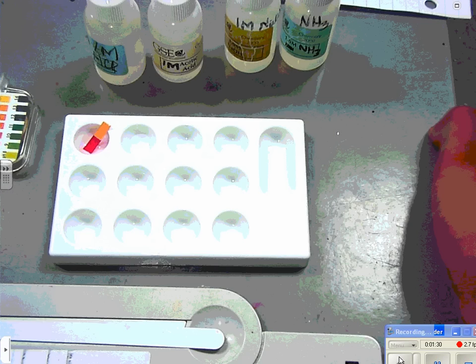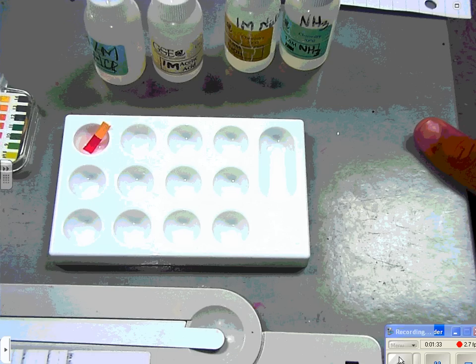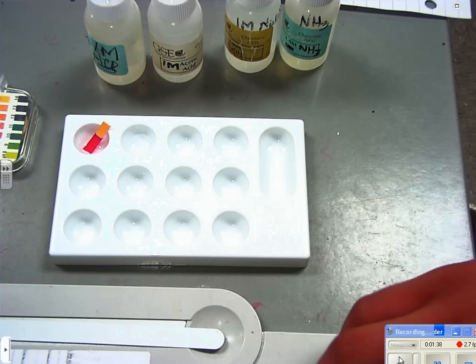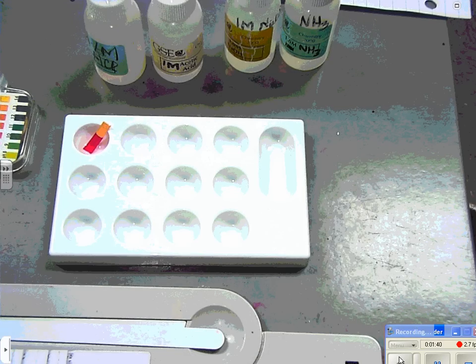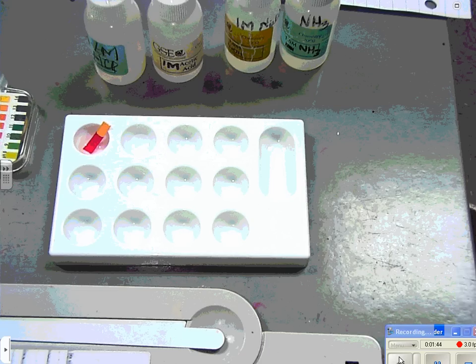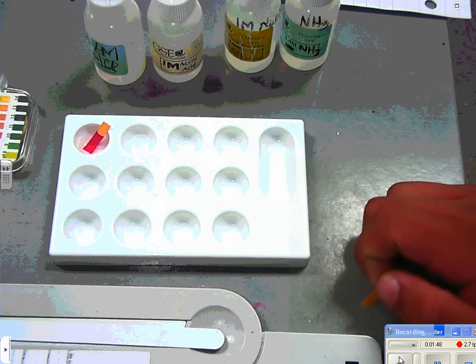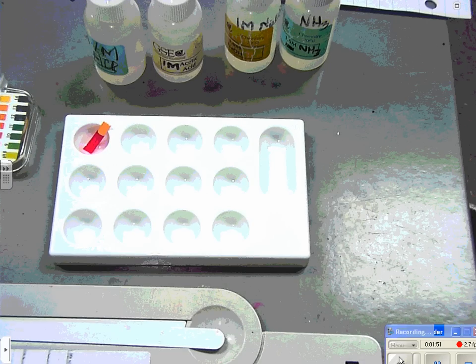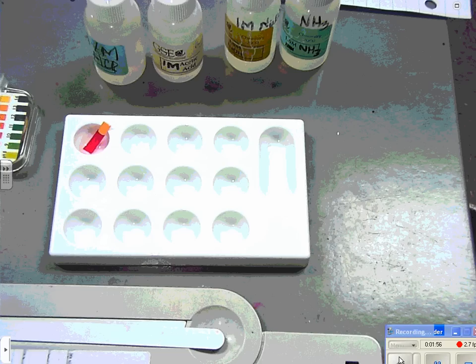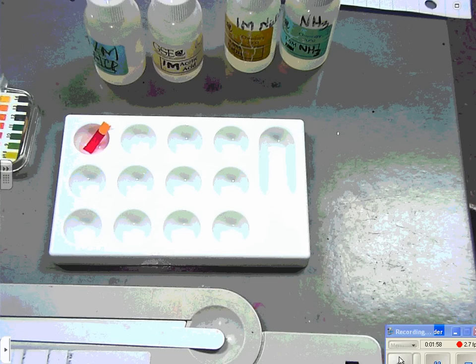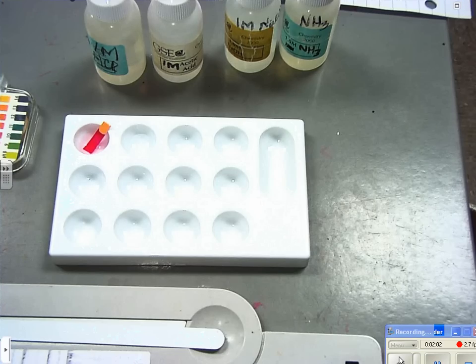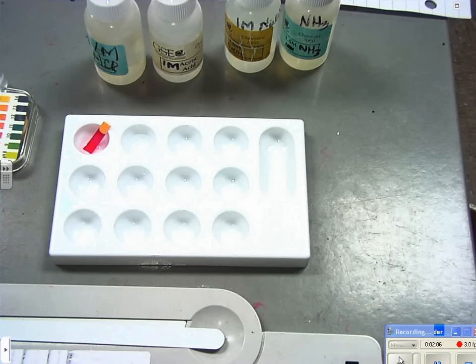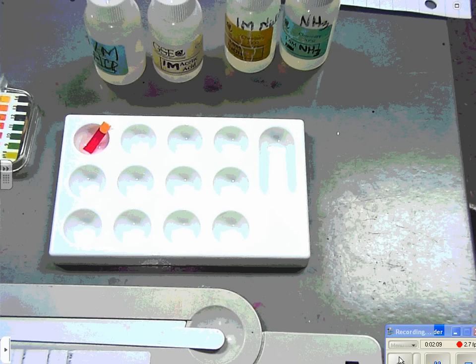Now we're gonna leave that in there and you're going to see by the time we finish that pH will actually change because hydrochloric acid is a gas, it prefers to be in the gas state. It does dissolve in water and when it does it ionizes 100%, but it will go back to the gas state as much as possible, as fast as possible. You will actually see a change in pH which means about 10% of hydrochloric acid is going to go back into the gas state in the time that we do this video.